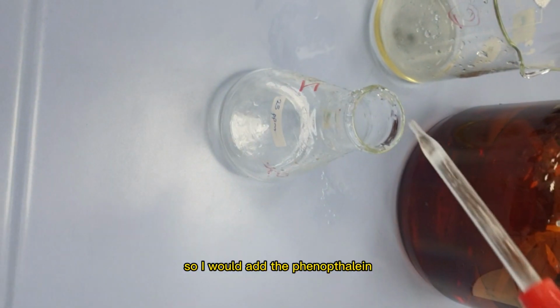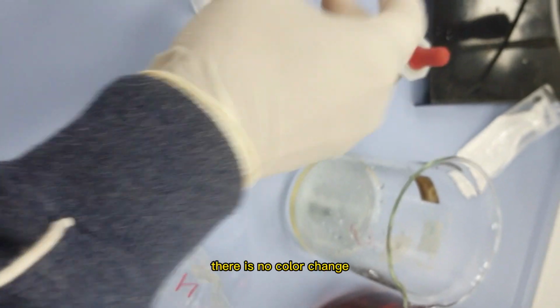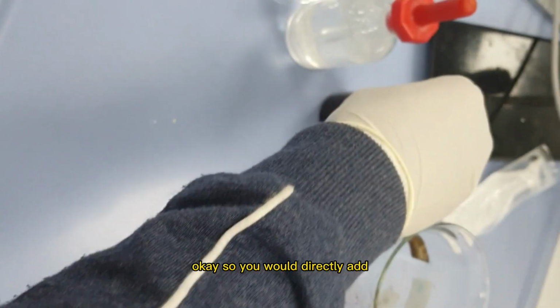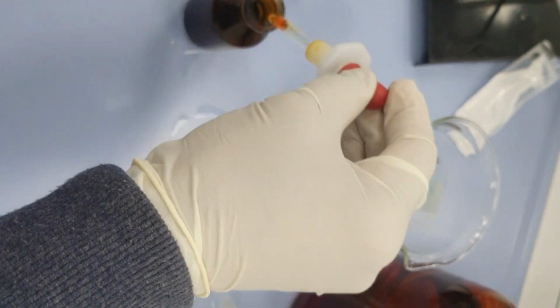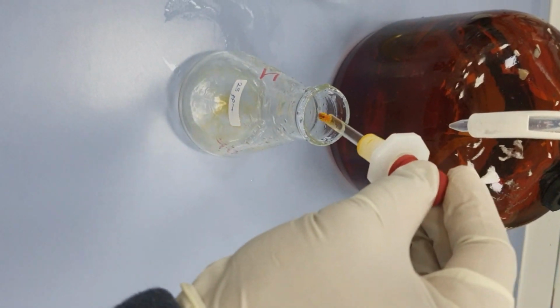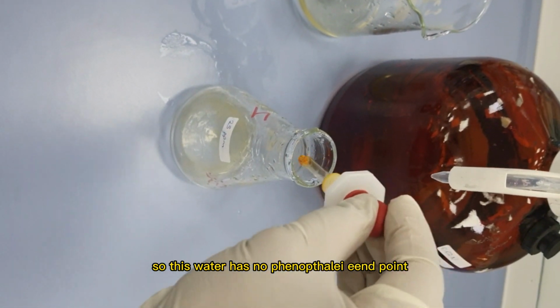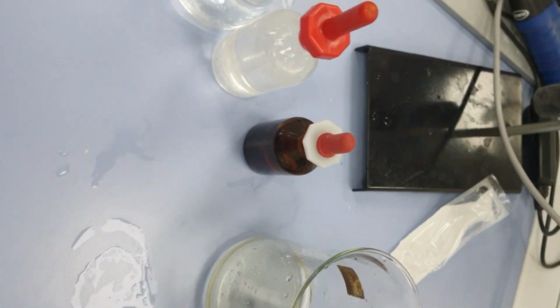So I would add the phenolphthalein. You can see when I'm adding phenolphthalein, there is no color change. So we would directly add the methyl orange indicator to this sample. This water has no phenolphthalein point, it has just the methyl orange point.